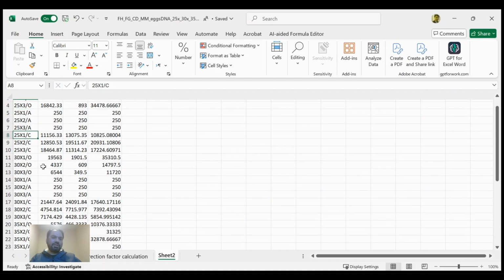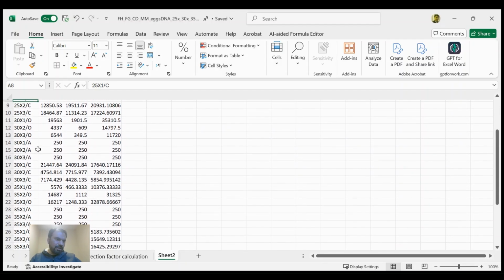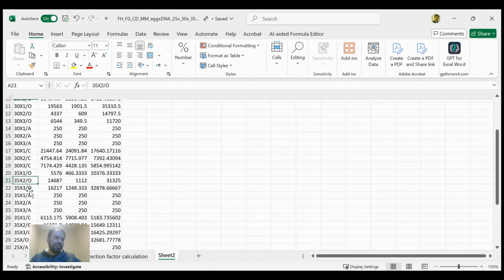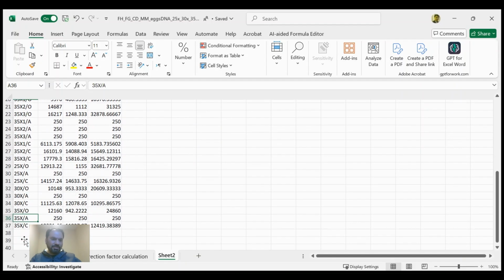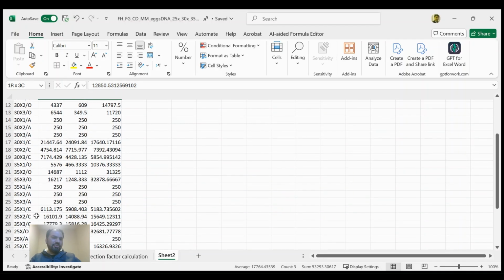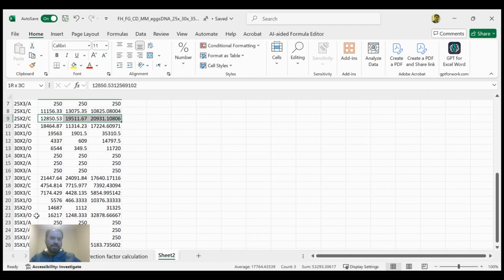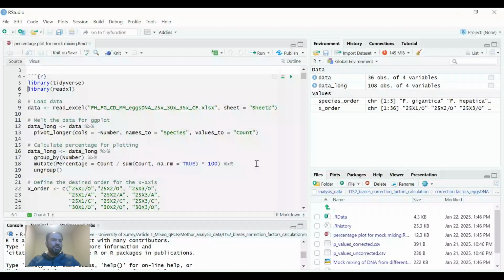So we will generate its percentage bar chart in R, which I will show you after this slide. And similarly with the 30x and 35x, and with the average of all above, like 25, 30, and 35x of PCR data. And these are the number of reads that we have calculated in the previous sheet: observed, actual, and corrected for all PCR reactions. And from this data, we will generate a percentage chart, which I'm going to show you just now. So here I will show you how we can produce a percentage bar chart using R.